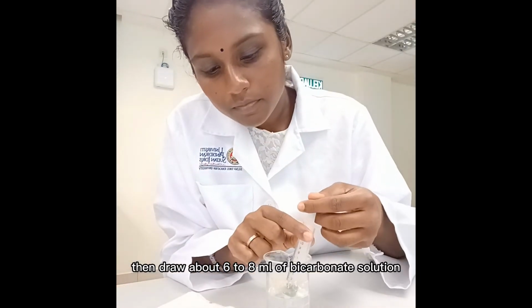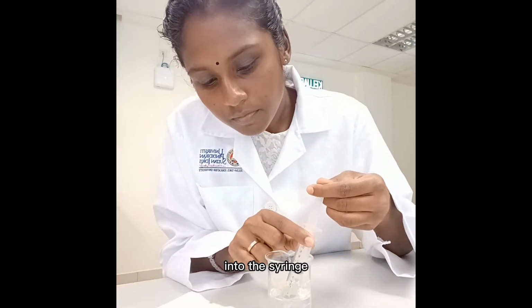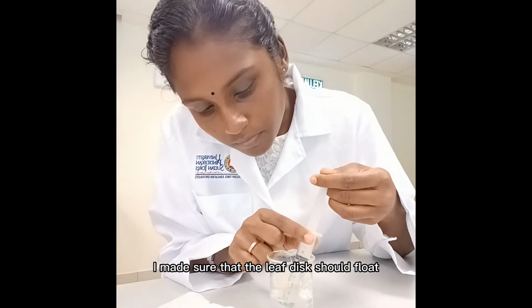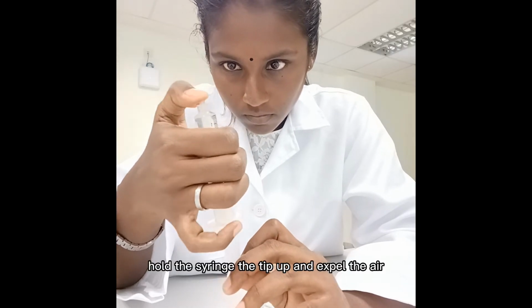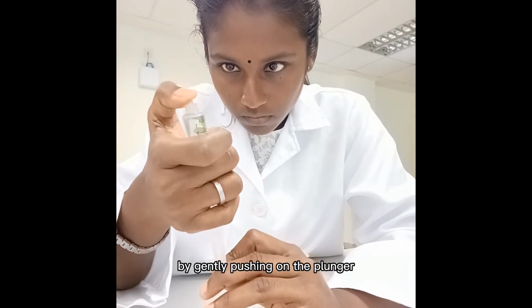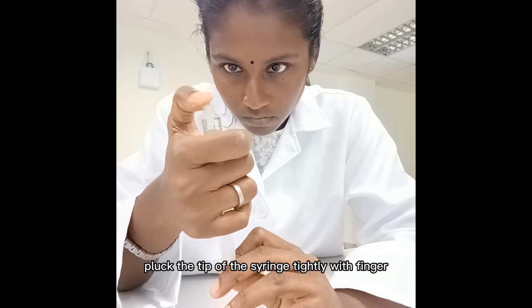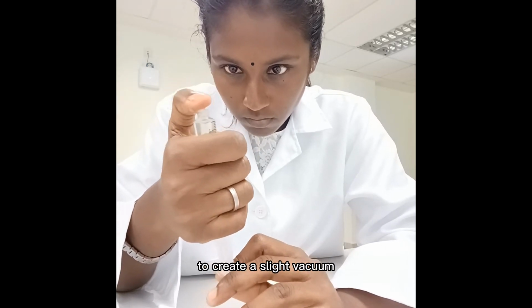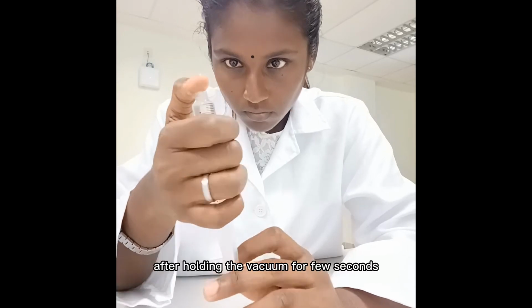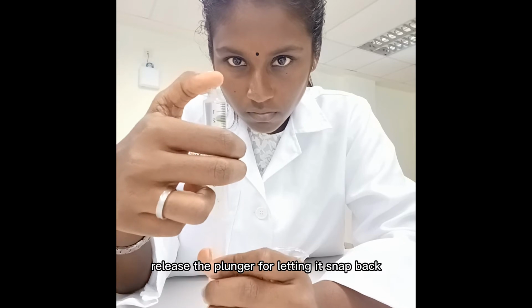Then draw about 6 to 8 ml of bicarbonate solution into the syringe. I made sure that the leaf discs float in the solution. Hold the syringe tip up and expel the air by gently pushing on the plunger. Plug the tip of the syringe tightly with a finger and gently pull on the plunger to create a slight vacuum. After holding the vacuum for a few seconds, release the plunger, letting it snap back.